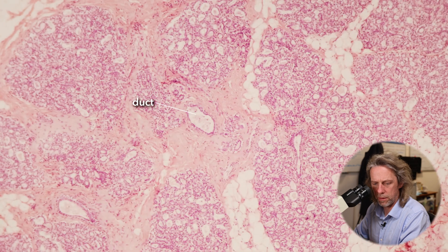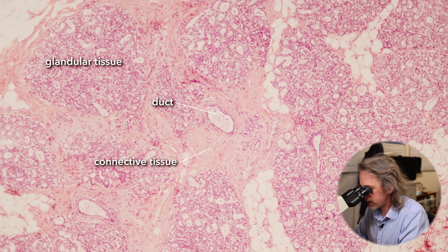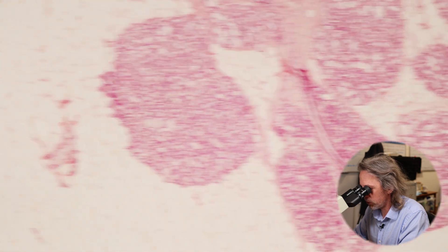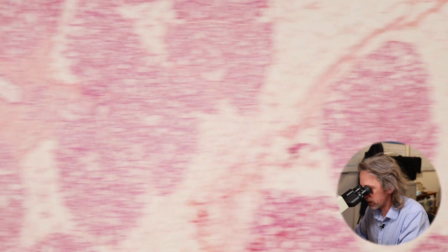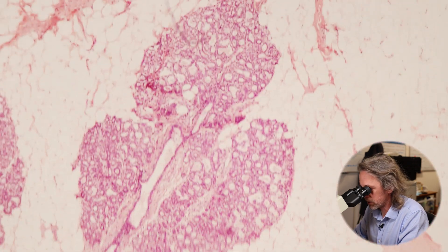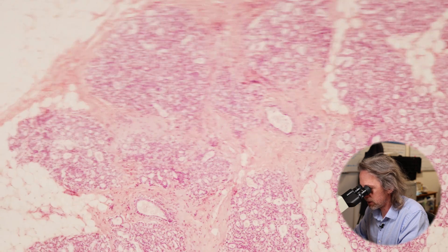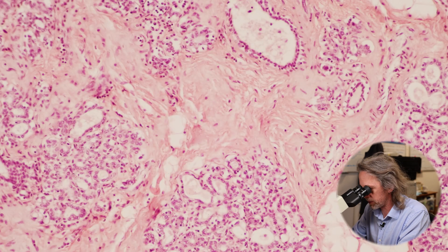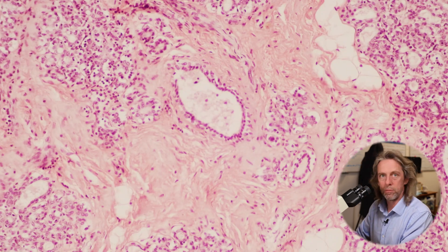We're seeing some bigger tubes, a lot of supportive connective tissue, and a lot of smaller tubes organized into little lobules, interspersed with fat and connective tissue. That was my four-times objective lens, which is 40 times magnification to my eyes because my eyepieces also magnify ten times.